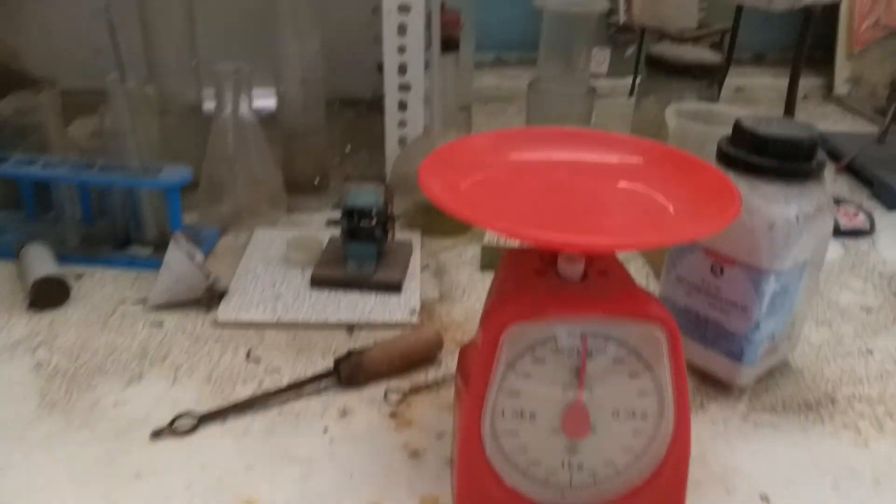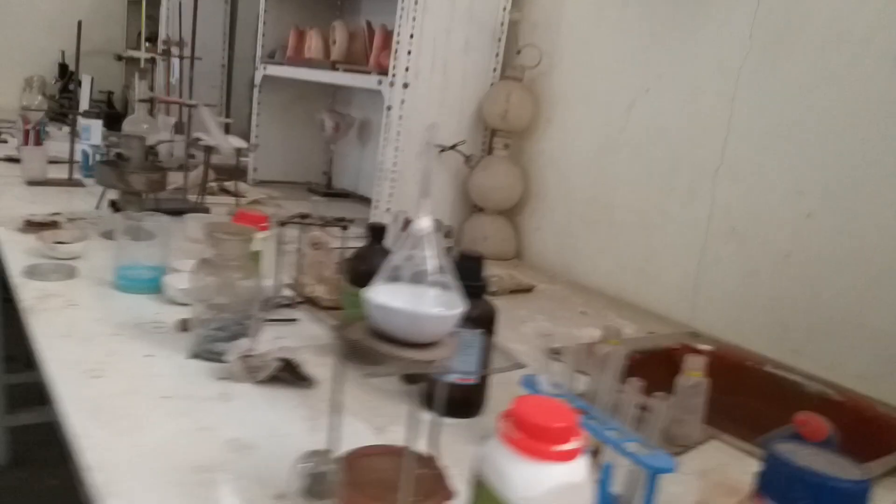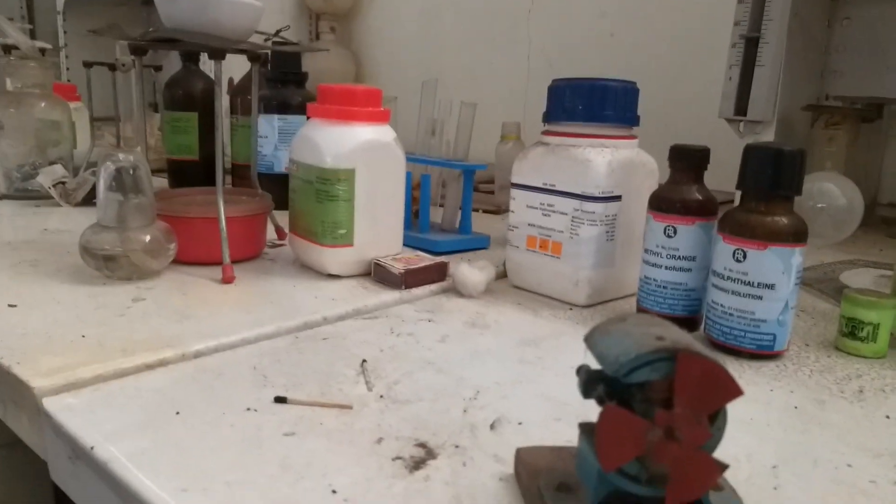Here is the human digestive system — these are some specimens of the human digestive system. This is a weighing balance, which we can use for measurements.